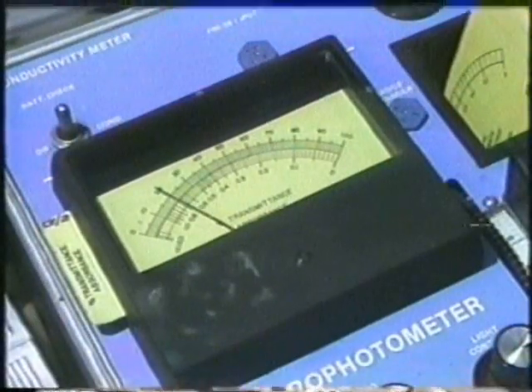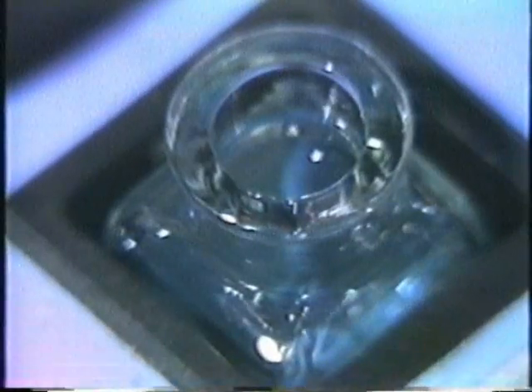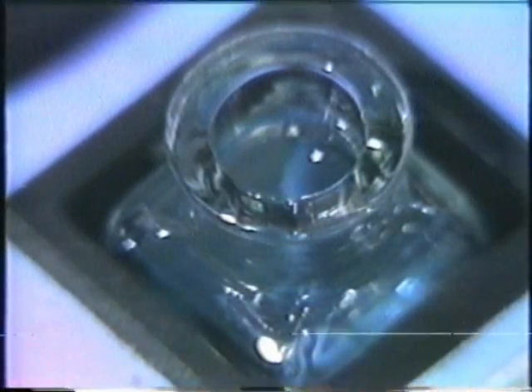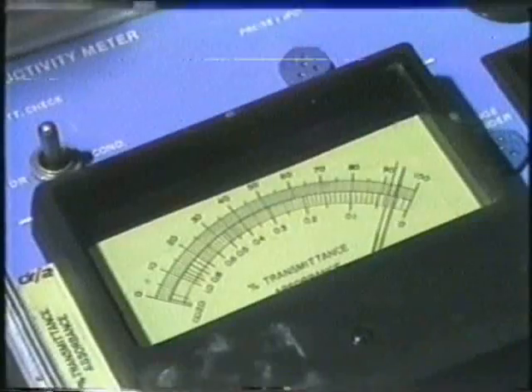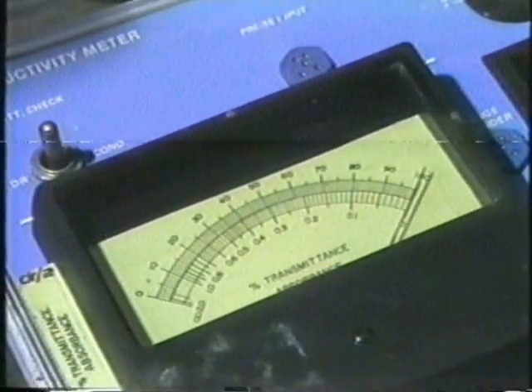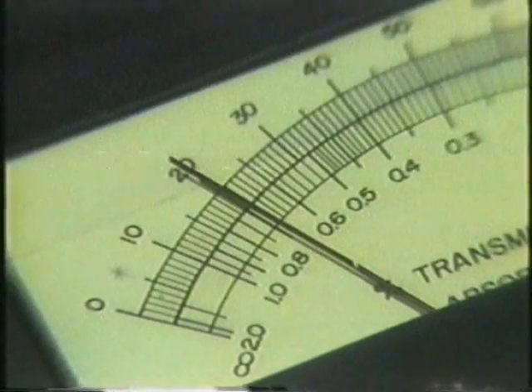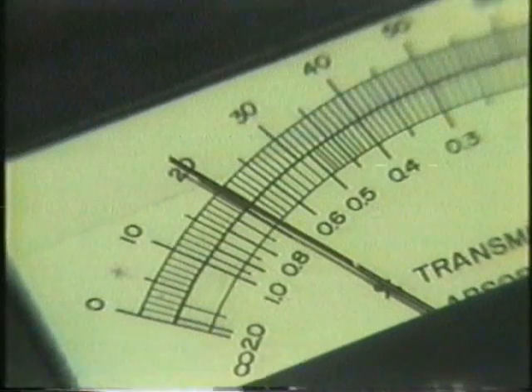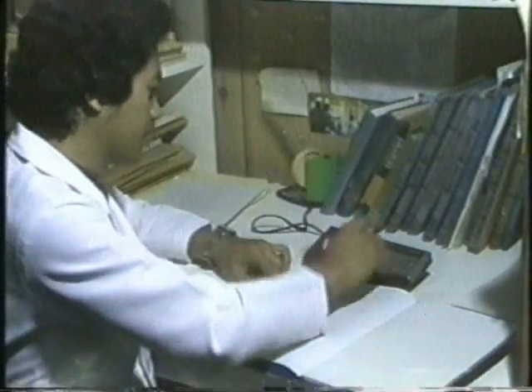The colorimeter tells color intensity in terms of percent transmittance. The treated distilled water, which is called blank as it does not contain ammonia, is set to read 100% transmittance. The lower the transmittance reading, the more intense the blue coloration is. Plugging in values into a complicated equation and with the aid of a calculator, we can compute for the amounts of ammonia nitrogen of our water sample.